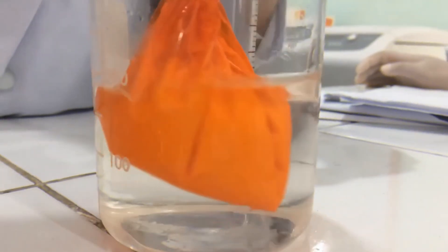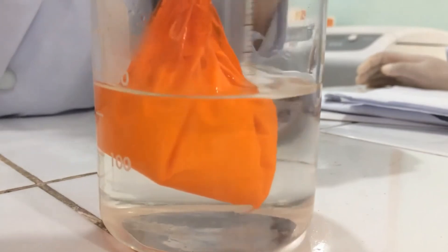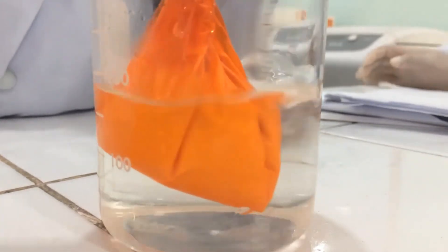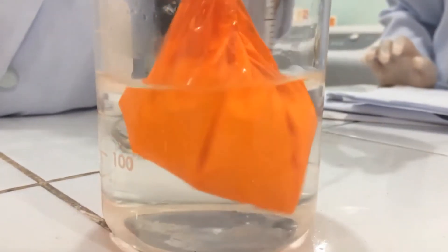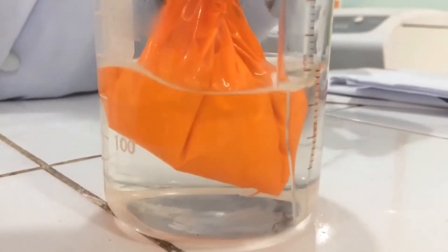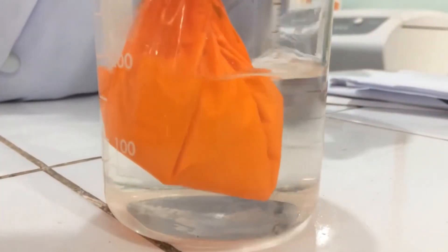For one hour, stir the water outside the milk and let the milk dialyze. Dialysis is undergoing if the water outside the milk is turning colloidal or turning white in appearance.